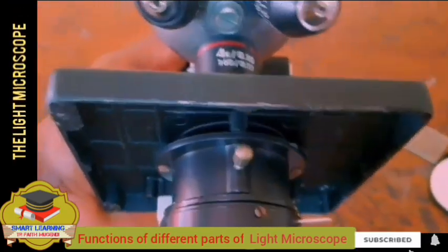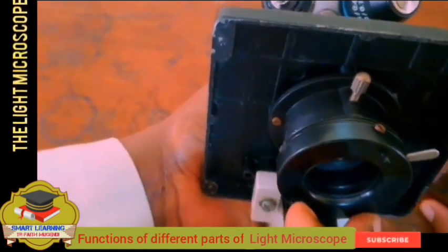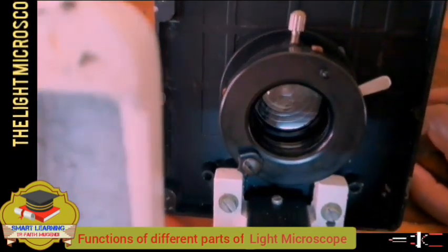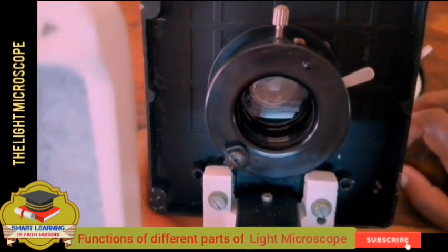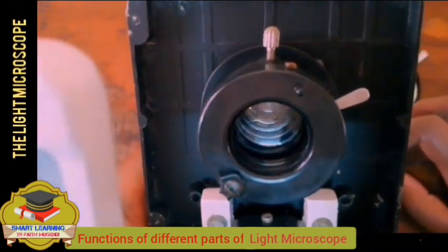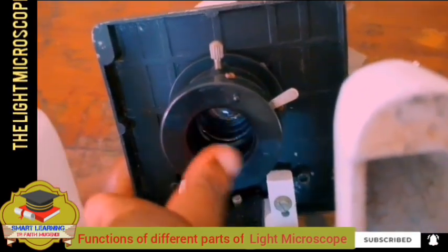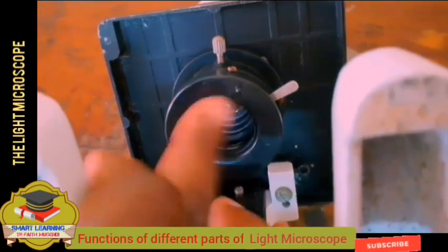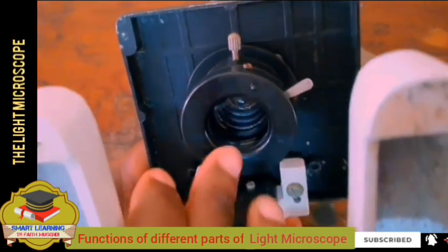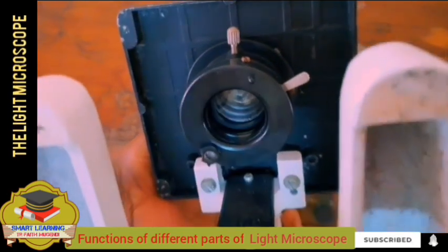From there we look at the diaphragm. The diaphragm is an aperture just below the condenser, just as we have seen that the condenser is inside the microscope and is a system of lenses. Whatever is below it is the diaphragm. The diaphragm is an opening just below the condenser, and this opening is used to regulate the amount of light entering the microscope.